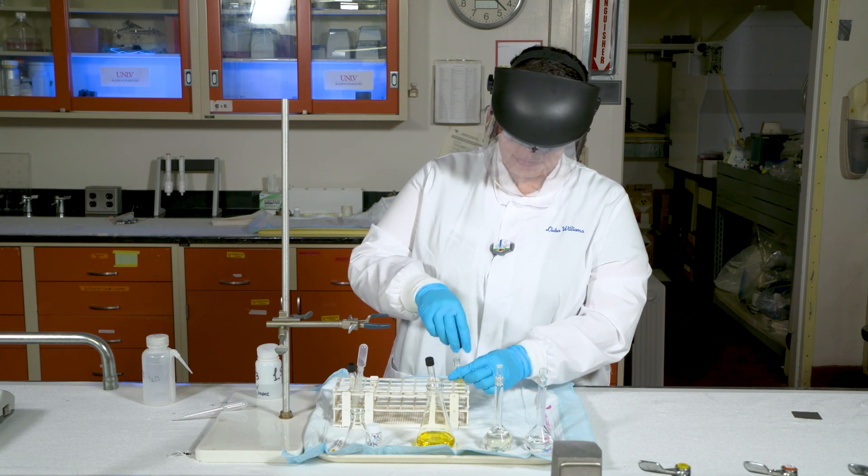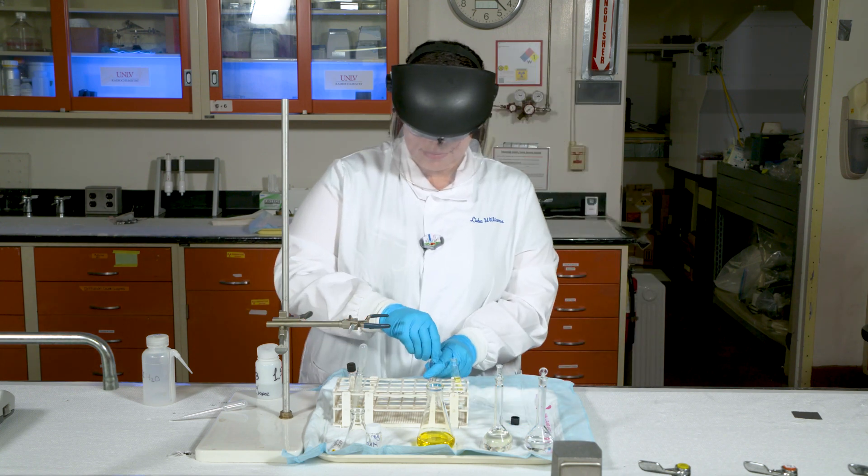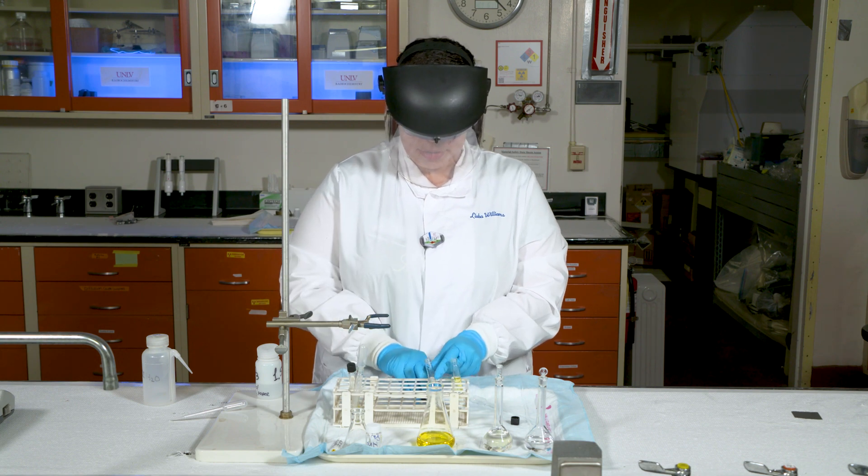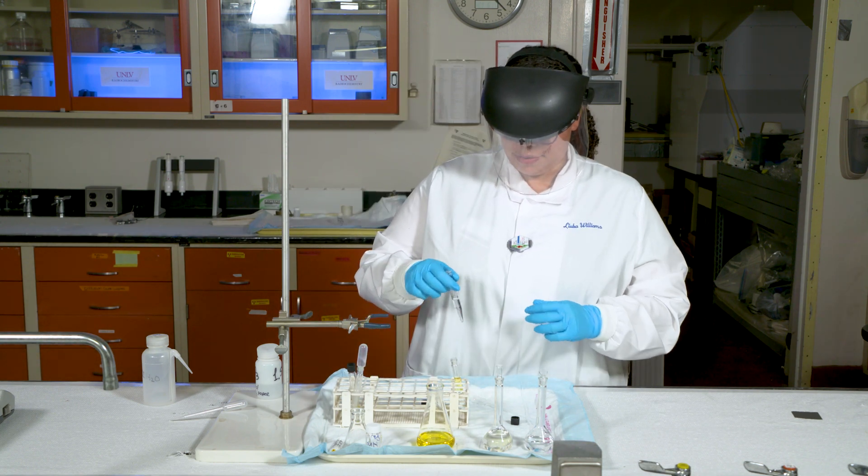Upon settling, the two phases separate completely. This process, called solvent extraction, selectively removes uranium from the solution, leaving all the impurities behind.